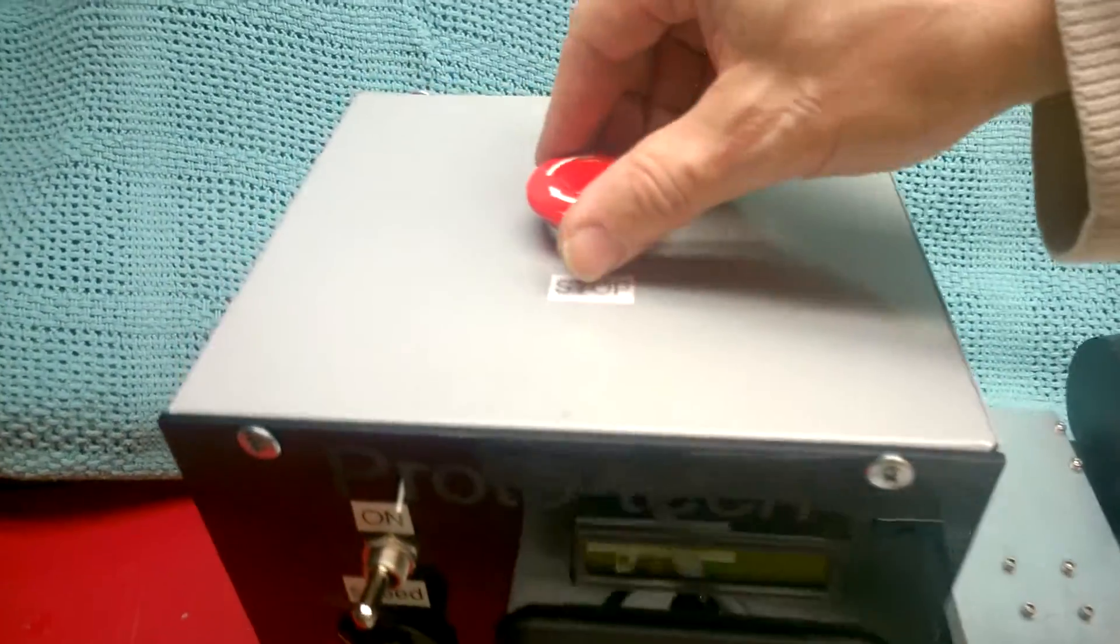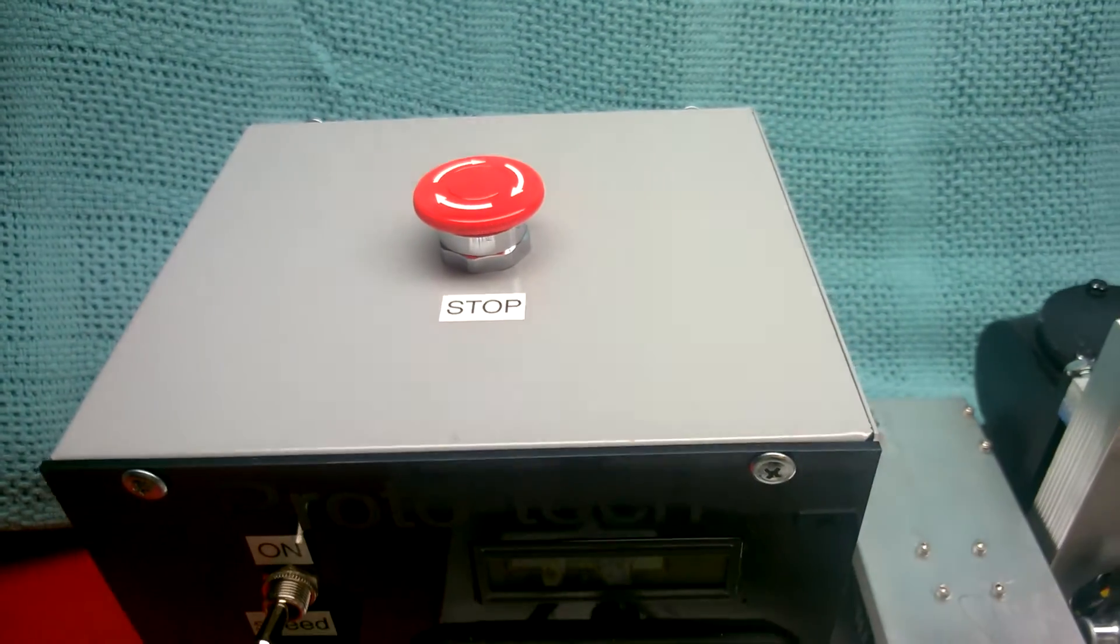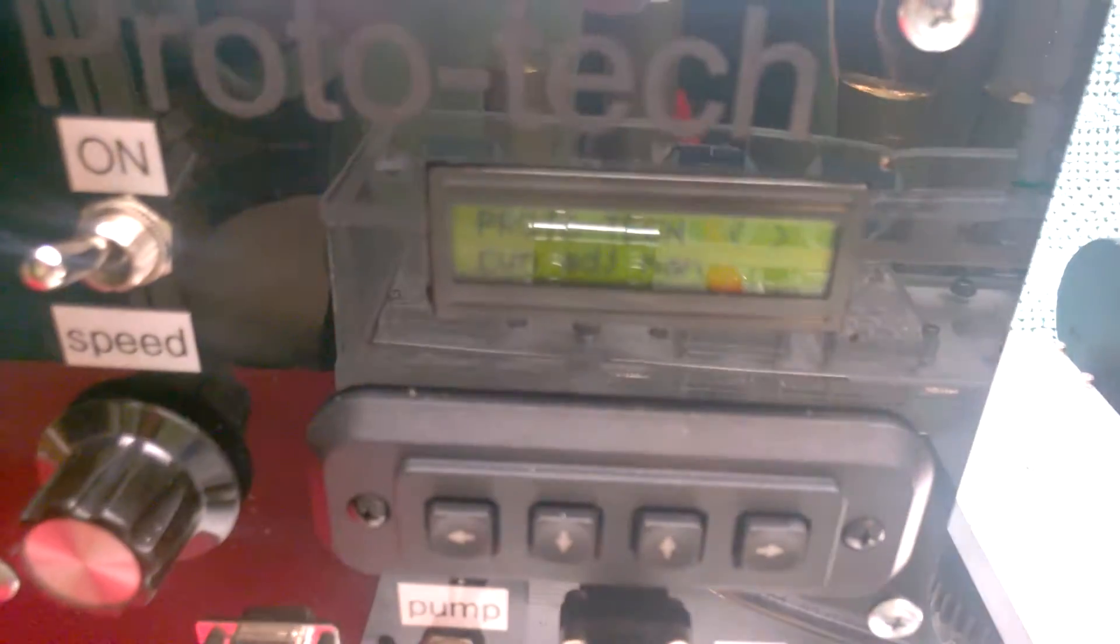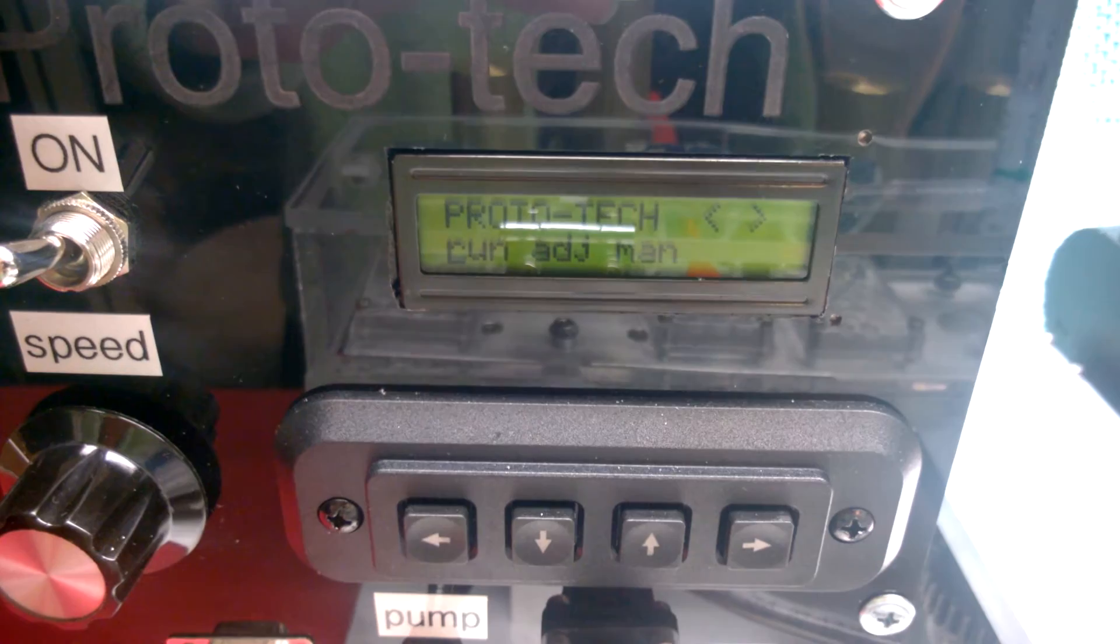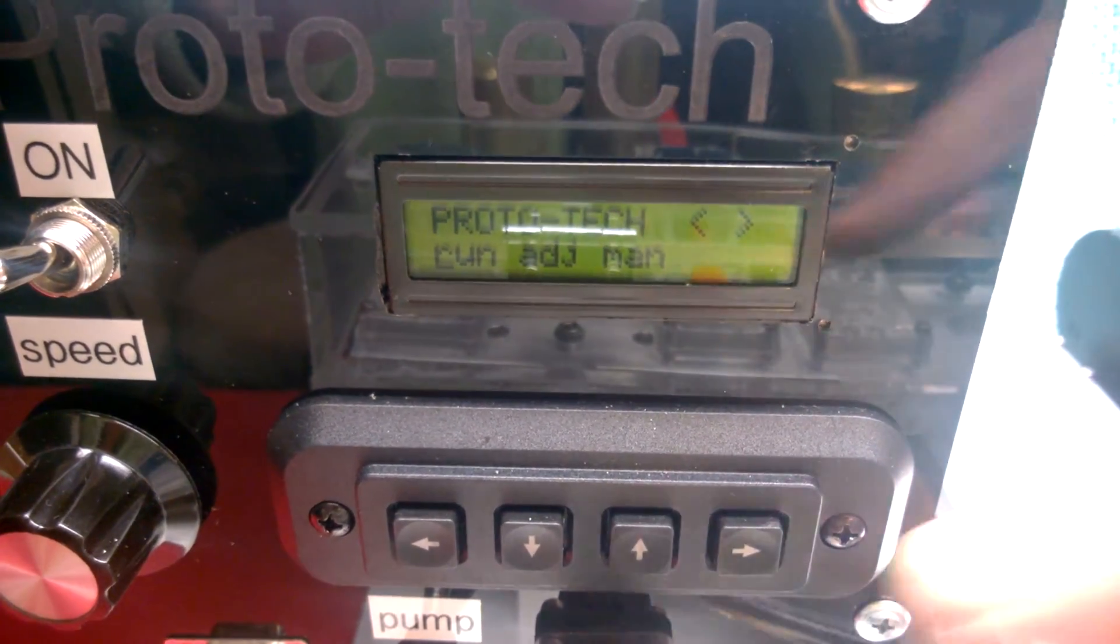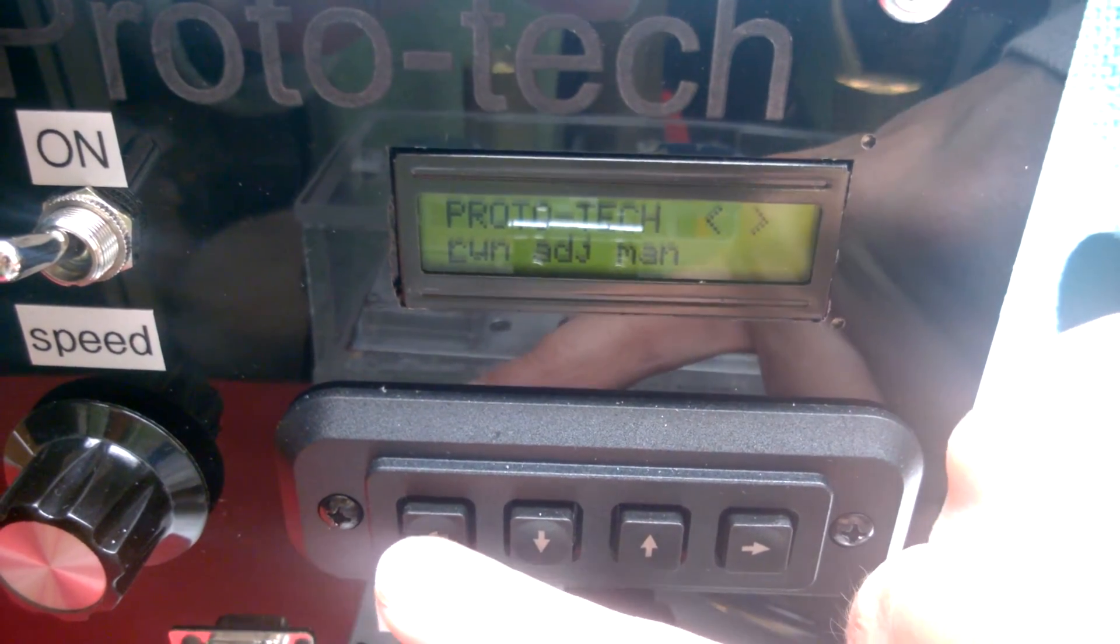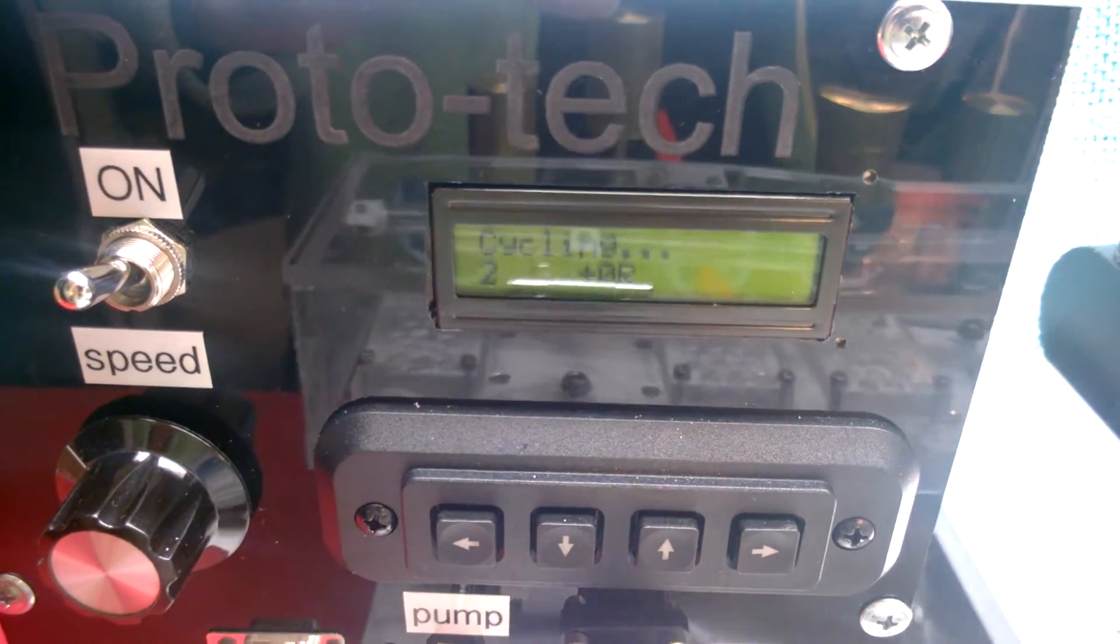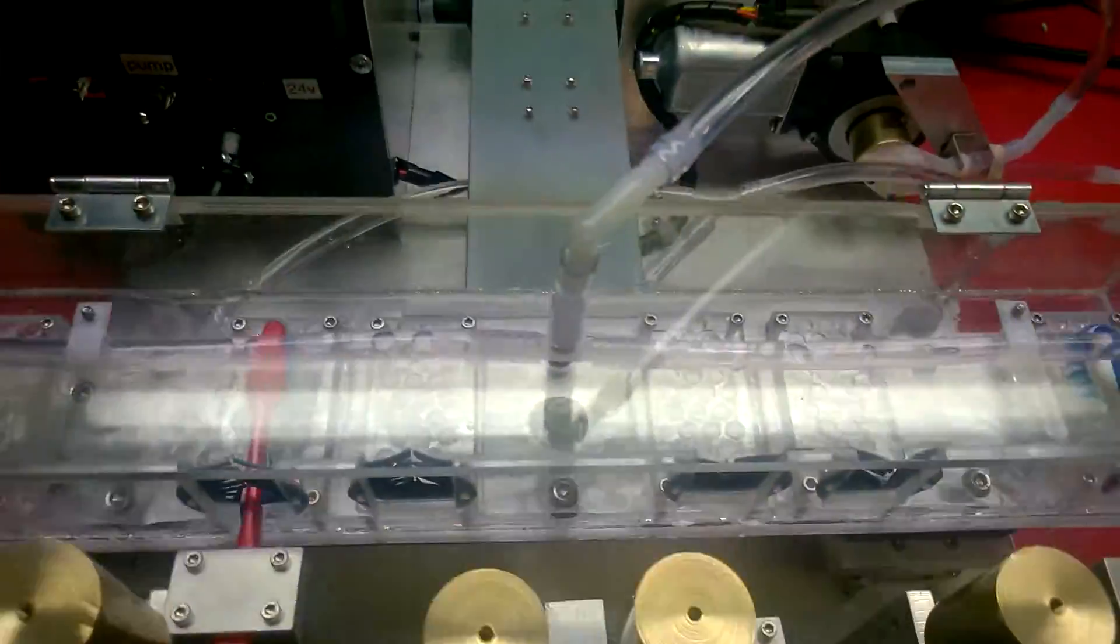Resume power by rotating it. But that doesn't resume the cycling. That just returns us to the top menu. And the pump is still on. And disaster's been averted. But it's ready for more cycling if we choose to. And those are all the salient features of the Toothbrush Wear Simulator by Prototech. Happy brushing.